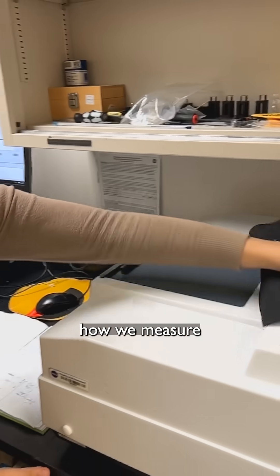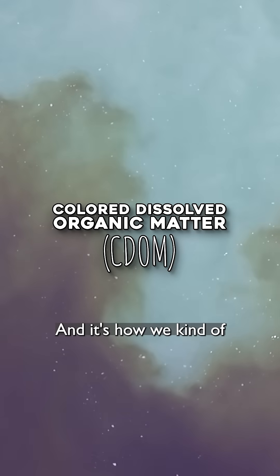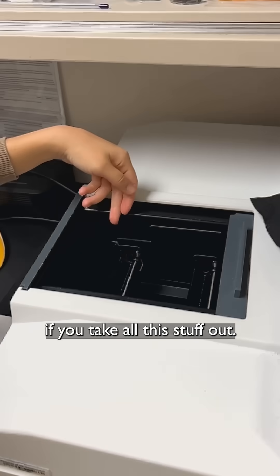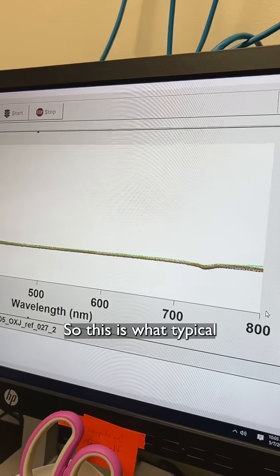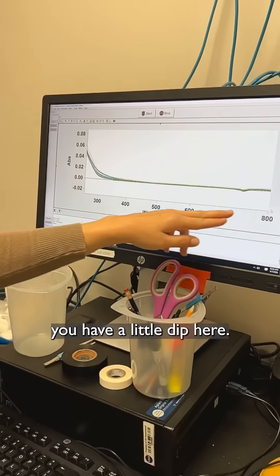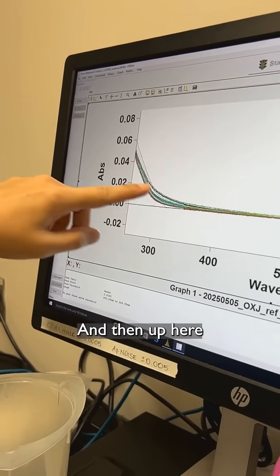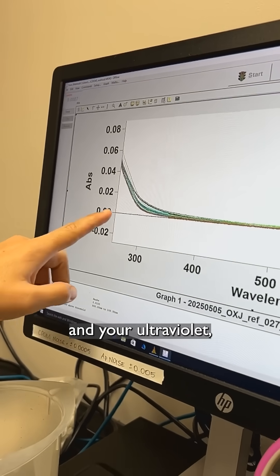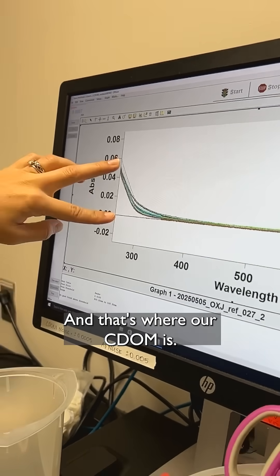This instrument is how we measure what's called CDOM — it's how we get a look at what color the water is if you take all the stuff out. This is what typical seawater looks like: at higher wavelengths you have a little dip, that's kind of what salt looks like, and up here in the lower wavelengths in the ultraviolet you have a higher signal, and that's where our CDOM is.